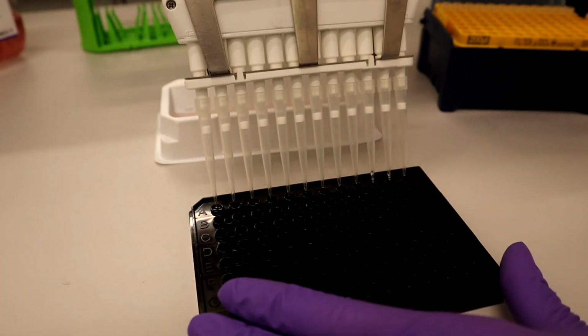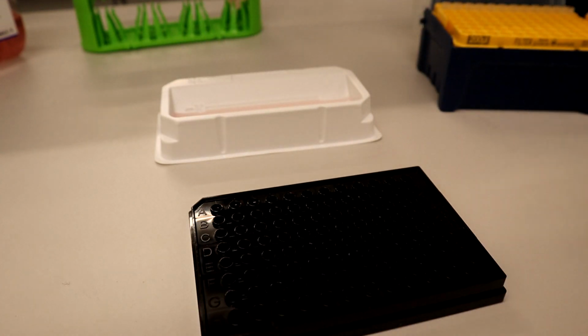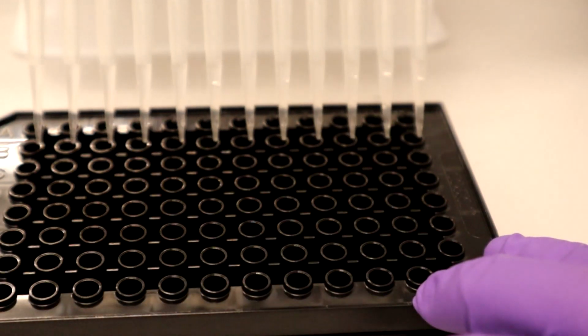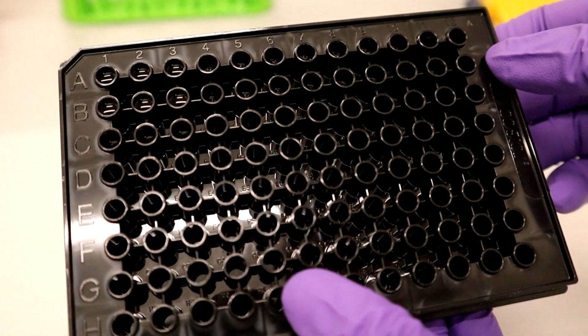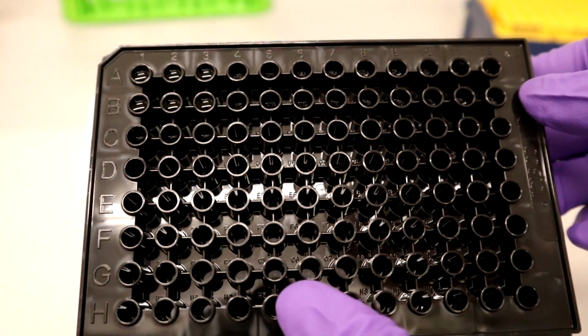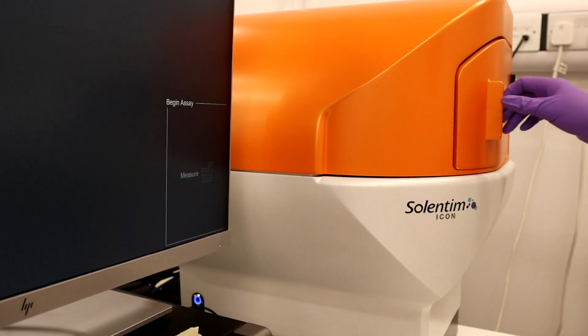Once mixing is complete, dispense to the first stop of your multi-channel pipette and remove the tips from the well. It is important not to dispense to the second stop, as this will likely introduce bubbles to the titer plate. Replacing your multi-channel tips each time, repeat this process for the remainder of the wells containing your standards. Your standard curve setup is now complete. Visually inspect the titer plate to ensure no bubbles have been introduced during setup and that all wells have a final volume of 120 microliters.